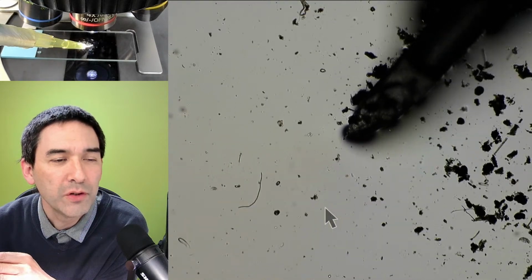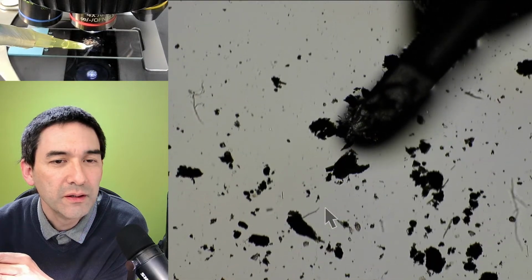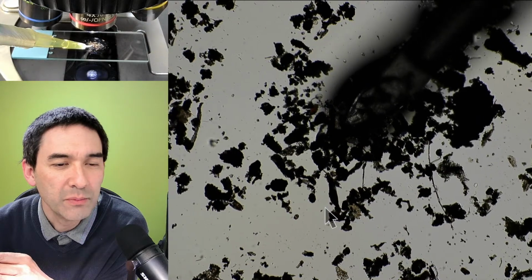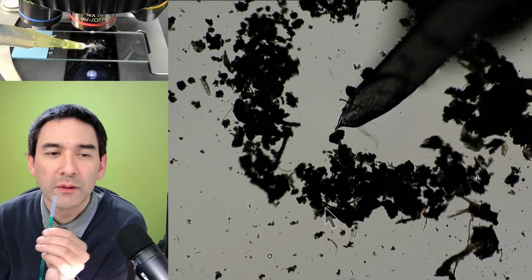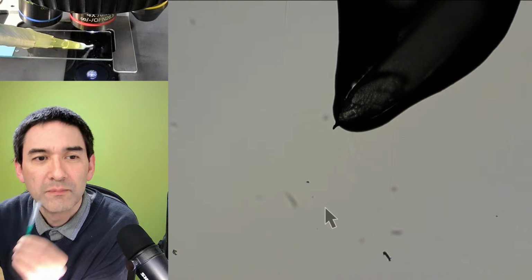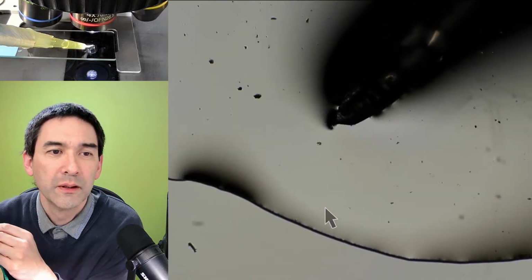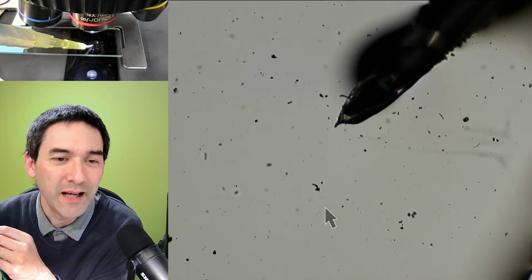You can basically position this little tip wherever you want to have it. Whatever I want to suck in here, I mean, you get the idea. Maybe a little worm here, and suck it in. Okay, I hold it tight, and I just go somewhere else, and then you're able to transfer whatever you've got. This is kind of the idea that I have.